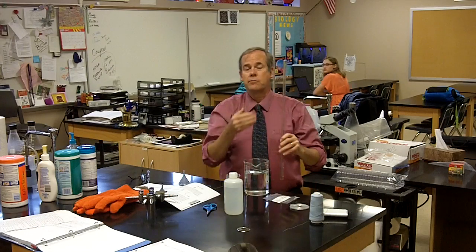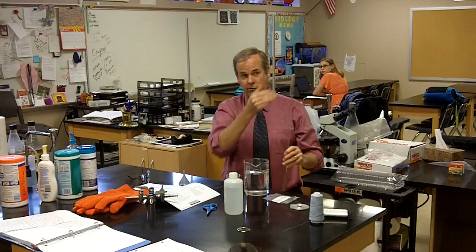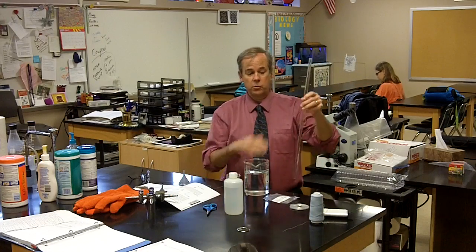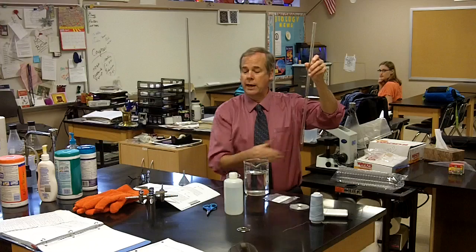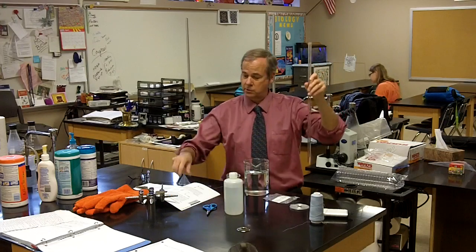So we know we're going to have two gases in this tube. We're going to have hydrogen and water vapor. So in order to do this we're going to place hydrochloric acid that's going to react with the magnesium in the bottom of the tube.